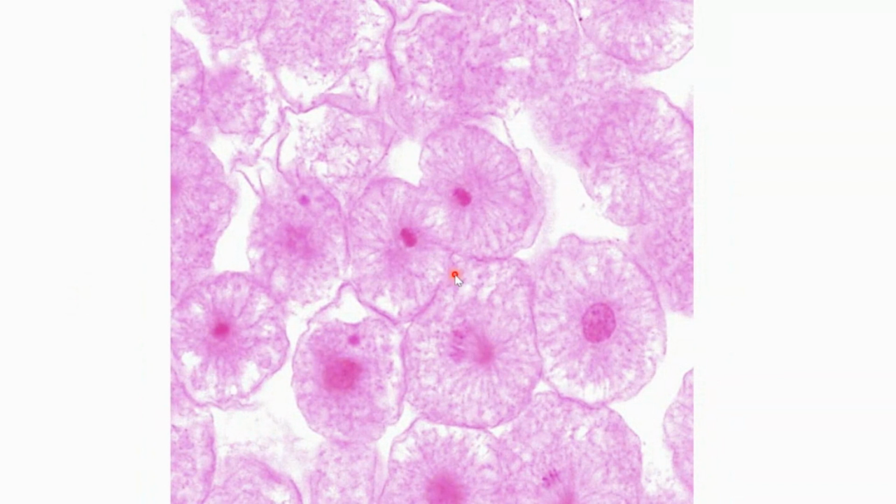Here's another telophase. See how I can see the cleavage furrow here on the top and on the bottom, and how I've got these two dark circles of genetic information. They're not moving away from each other anymore like we saw on some of those other slides. They're already moved. They found their new locations. Now we're just dividing up the cytoplasm to get these cells completely separate. So there's some telophase for us right there, again with those cleavage furrows that we see in the middle.